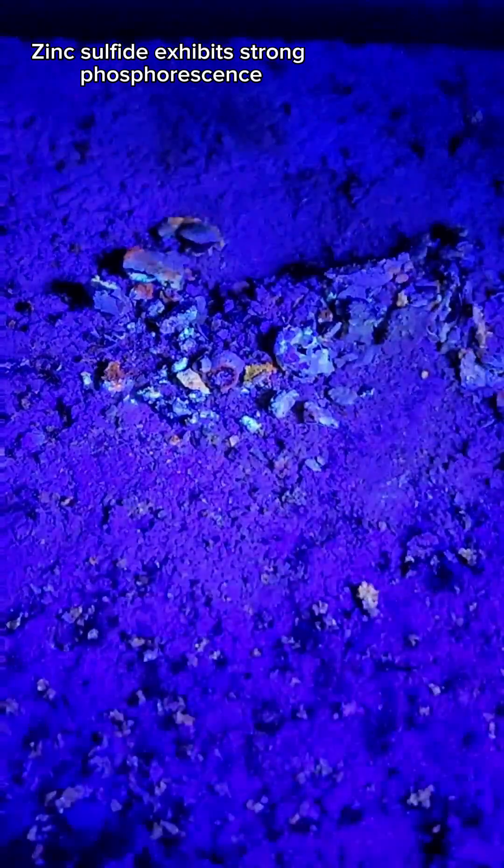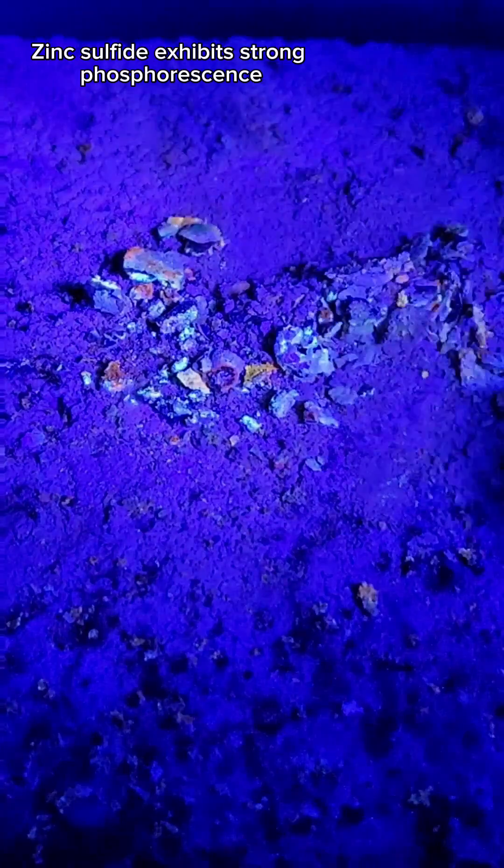Sorry, I didn't want to try to talk over that, but the unique property that zinc sulfide has is that it exhibits strong phosphorescence under UV light.